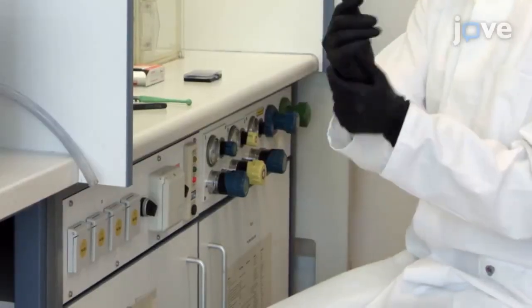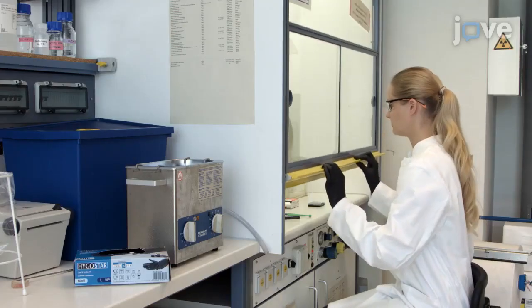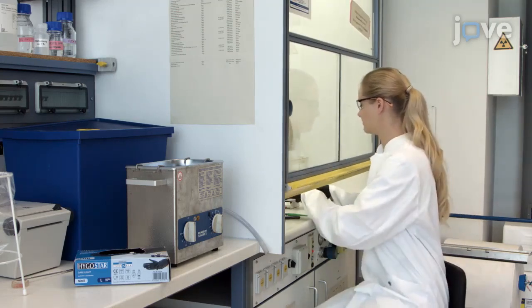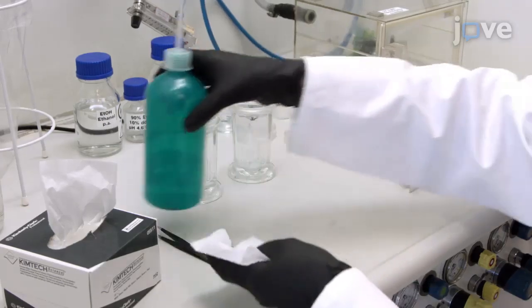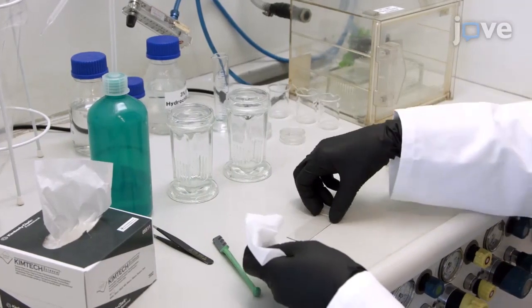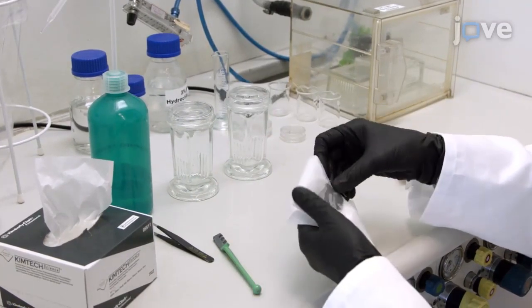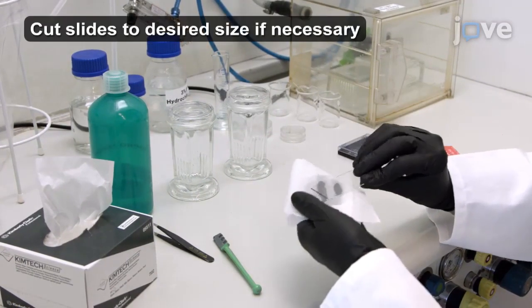To begin, put on acid-resistant gloves, safety goggles, and a laboratory coat. Under a fume hood, use isopropanol and lint-free precision wipes. Remove any coarse dust and contaminations from several glass slides.